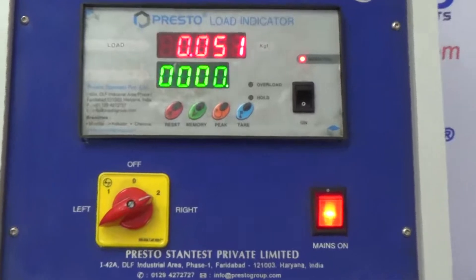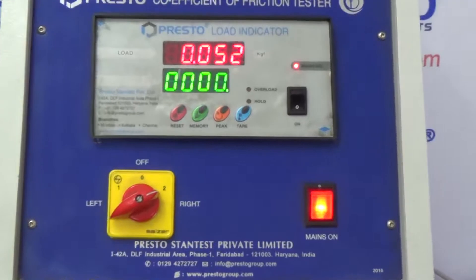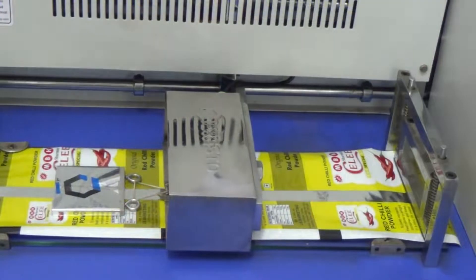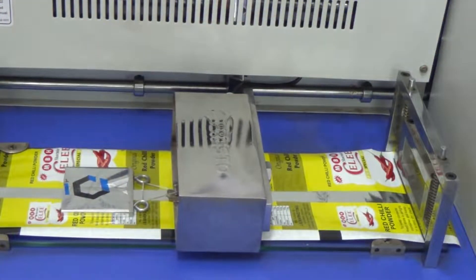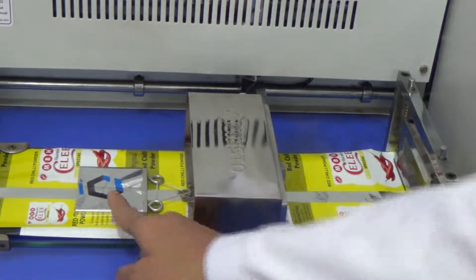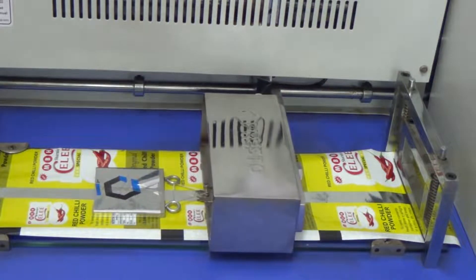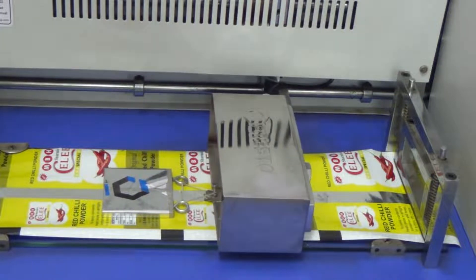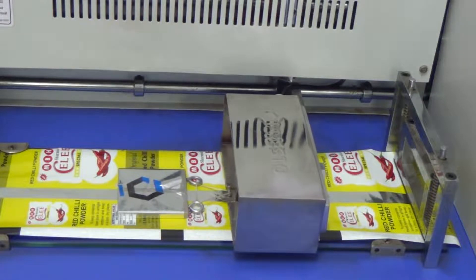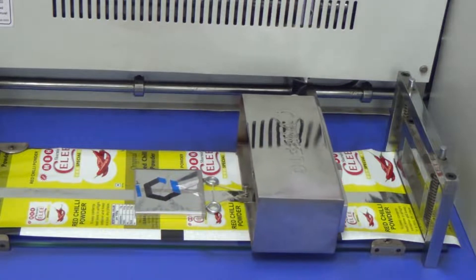Now move the rotary switch in the right direction to start the test. The display shows the dynamic friction of the sample. The instrument works with a speed of 150 plus minus 30 mm per minute with the slider block weighing 190 grams. Here we are testing film to film. There are 3 types of tests: film to film, film to metal, or film to glass surface.